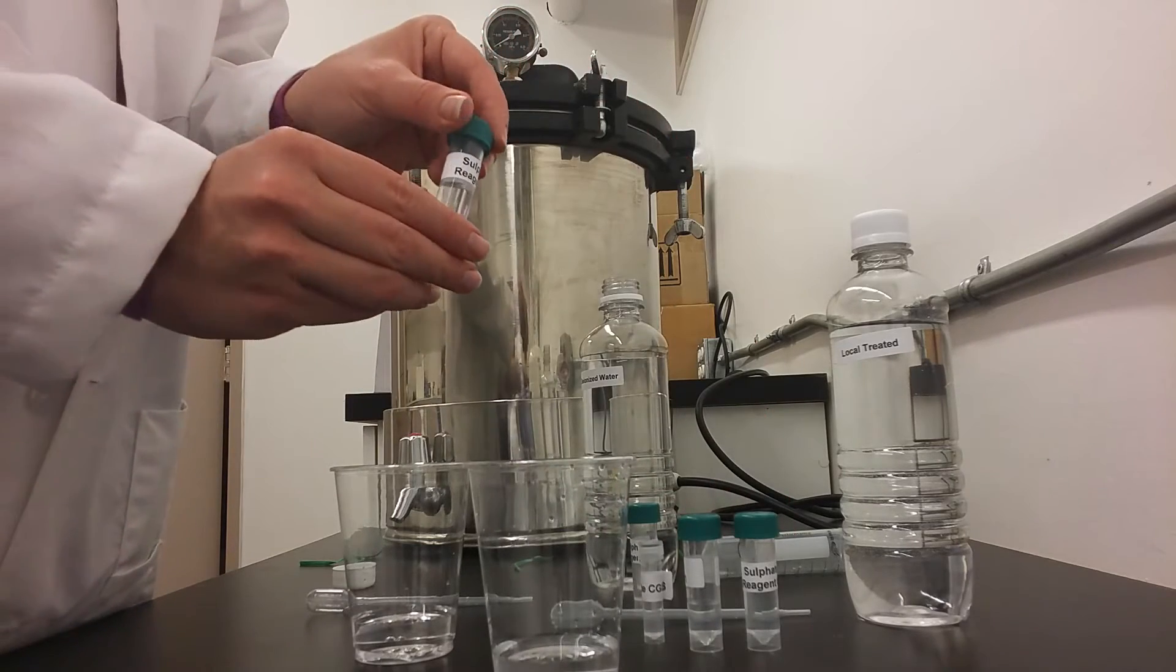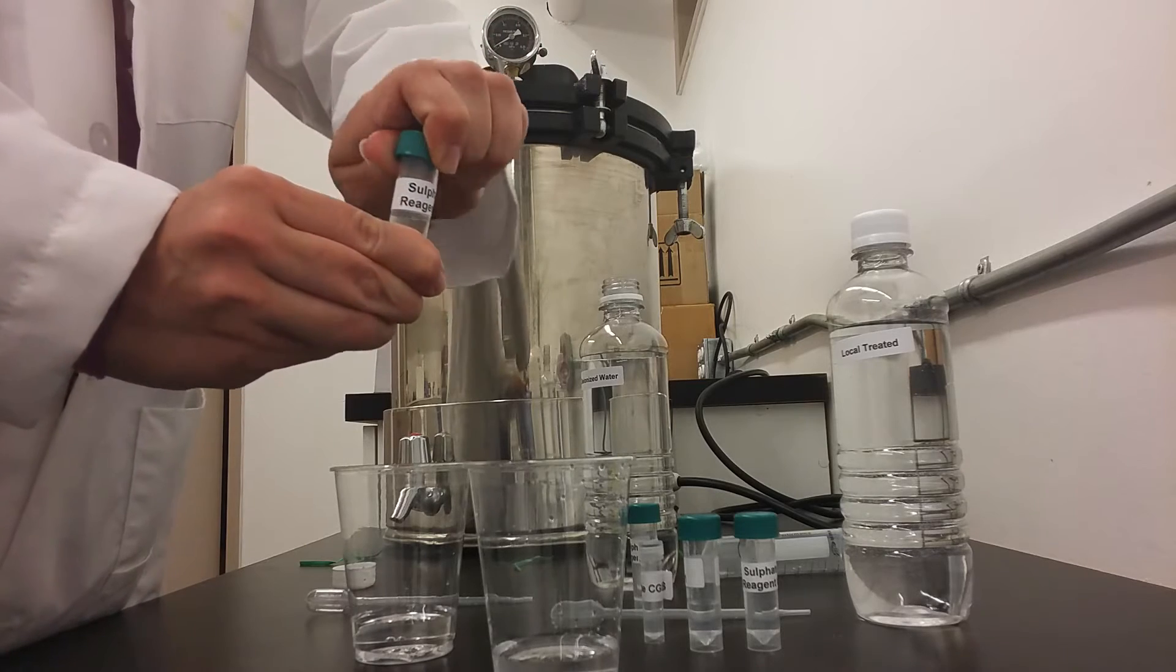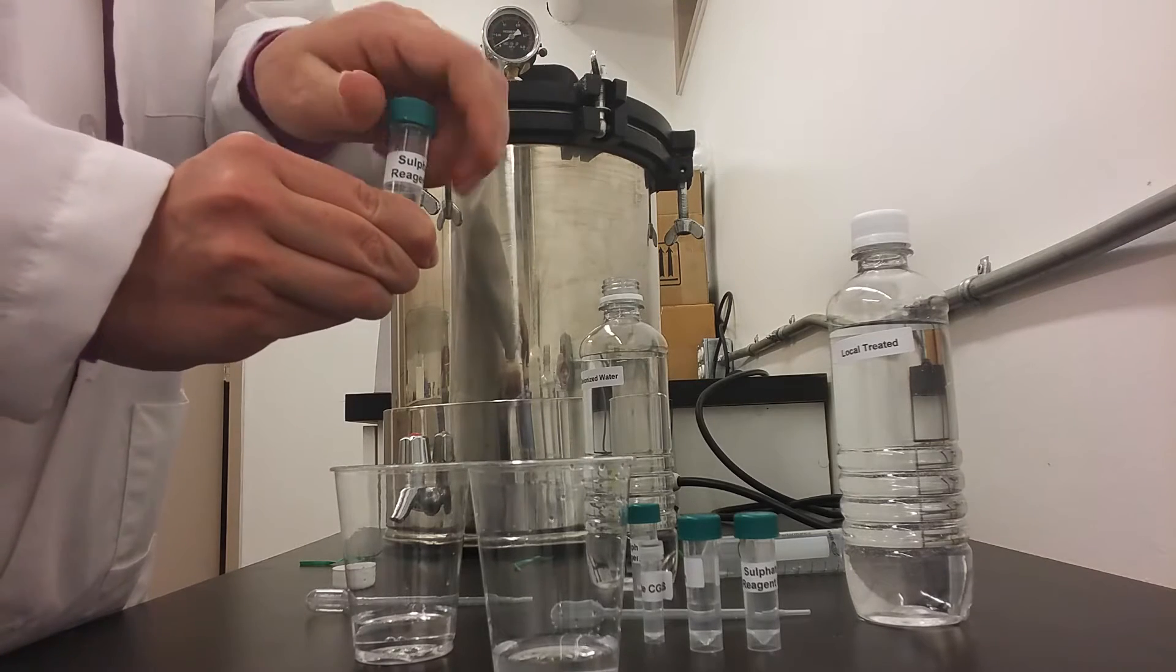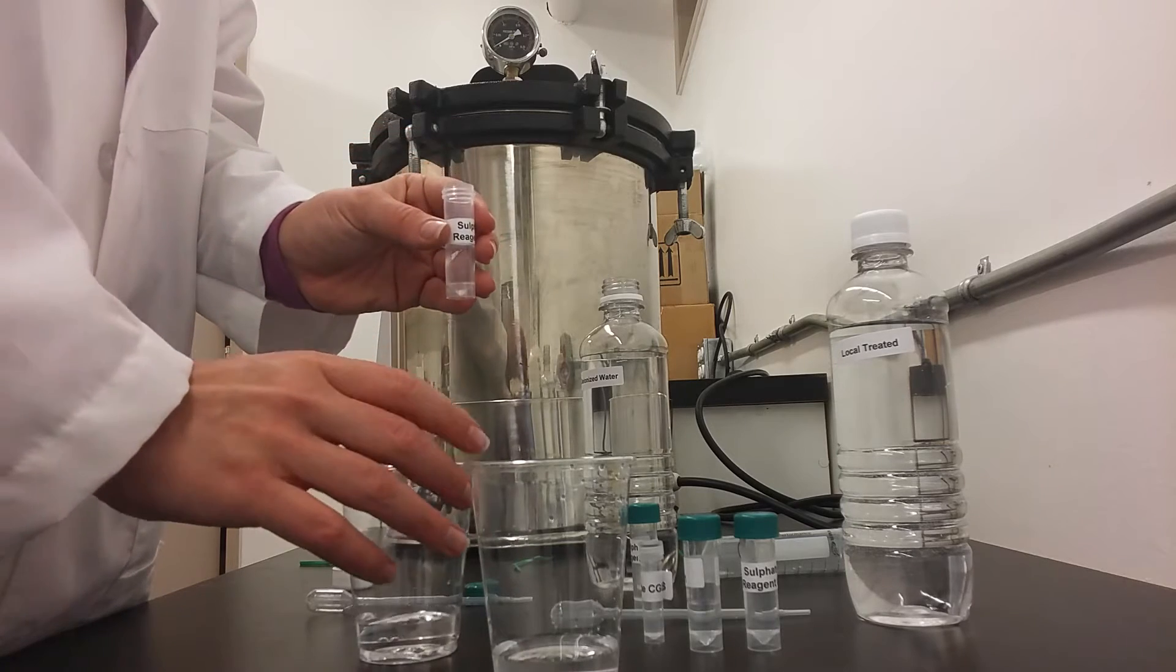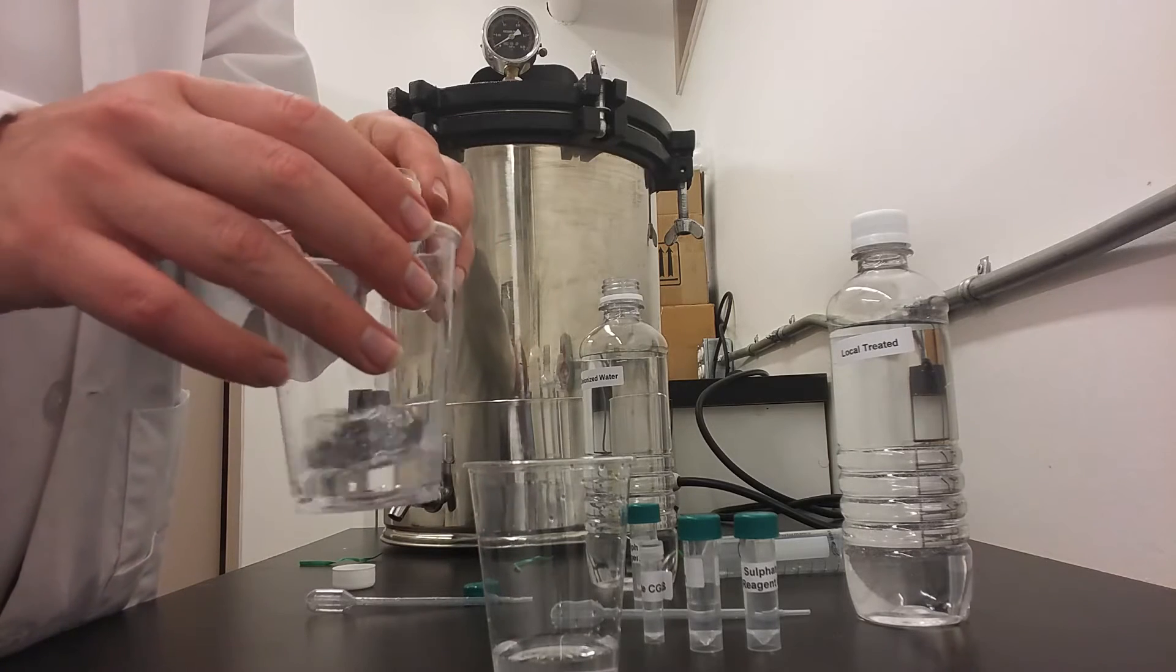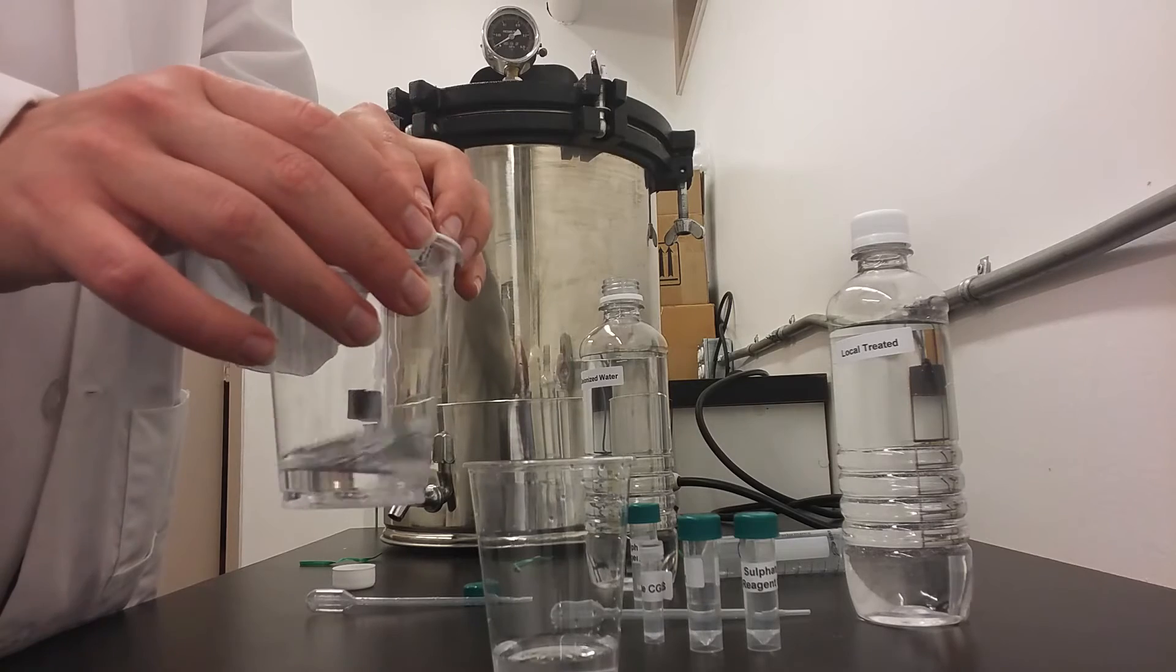Next, we will take reagent number 2, and we will add that while swirling the cup to the control cup.